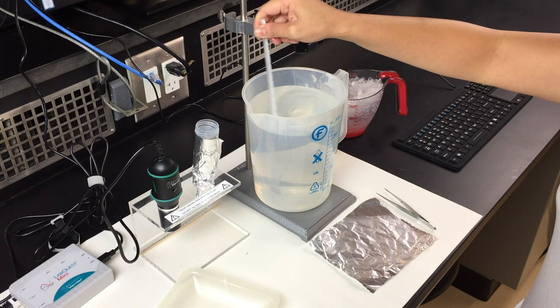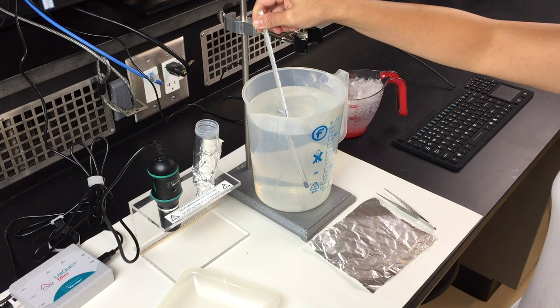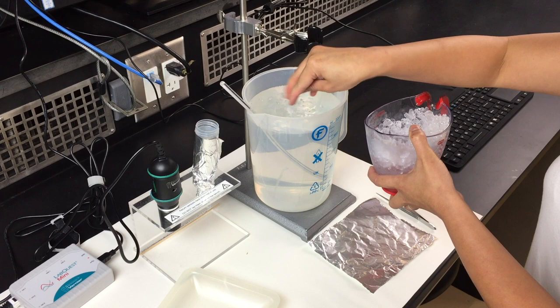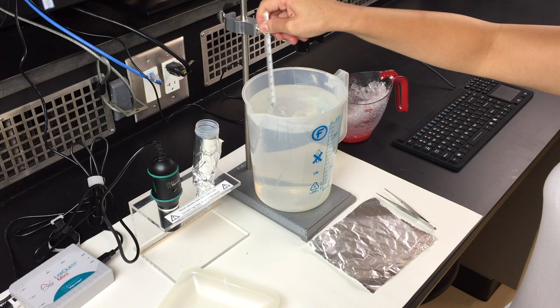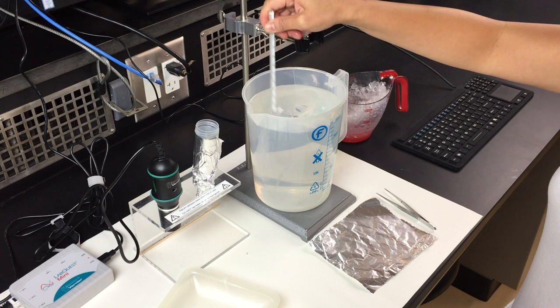Keep in mind that the temperature of tap water is at approximately 23 degrees Celsius. There is not much of a drastic change of adjustment that has to be done.